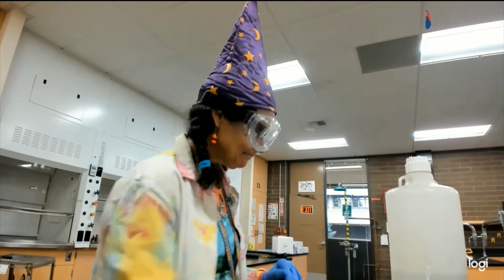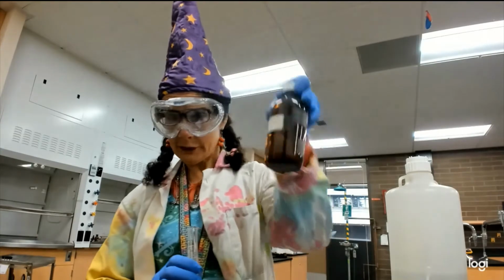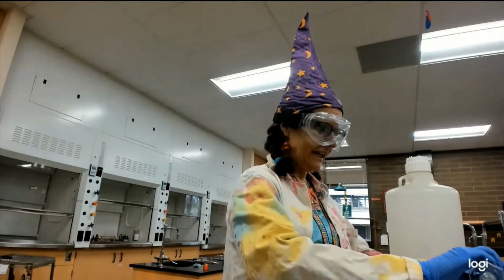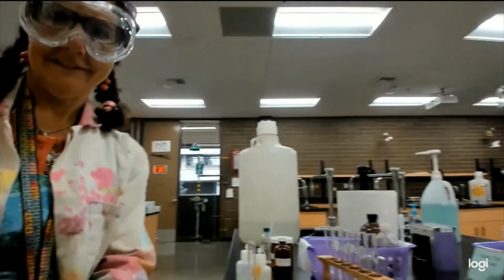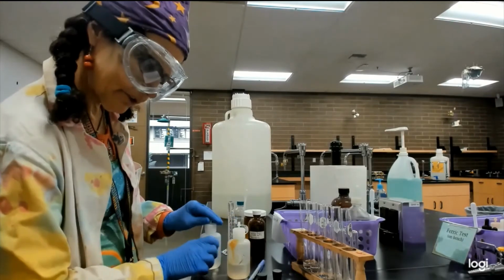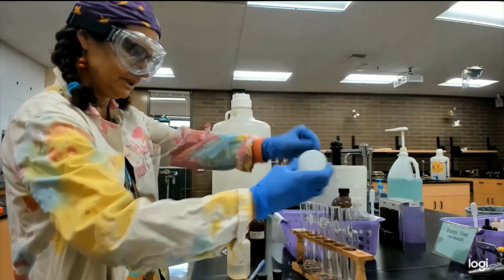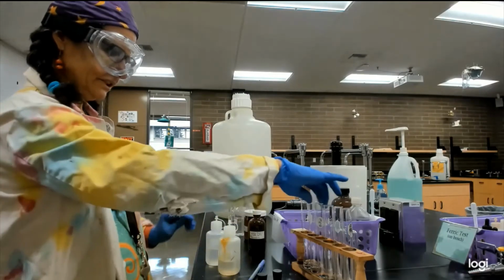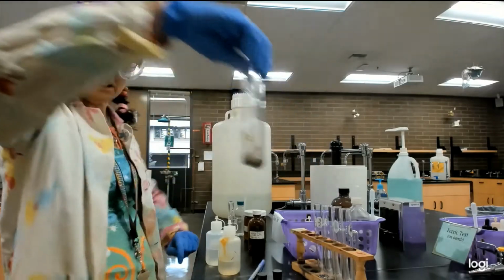So, the test says, let's take 2 milliliters of our silver nitrate solution. So, silver nitrate, that's somebody kindly made up for us. And we'll put it in our test tube. And I have to fix the camera so you can see this. It's much more exciting than watching me. And then we add 1 drop sodium hydroxide to each of our test tubes. All right. Oh. And that test tube, test tubes, look at that.